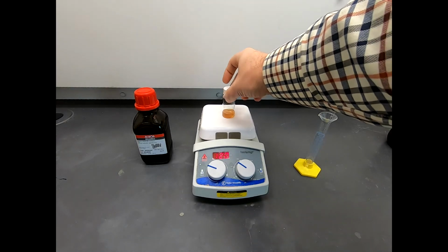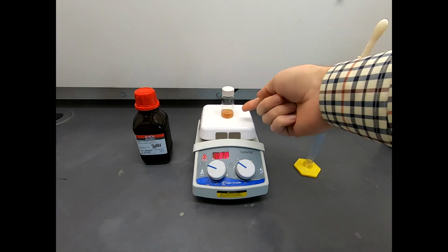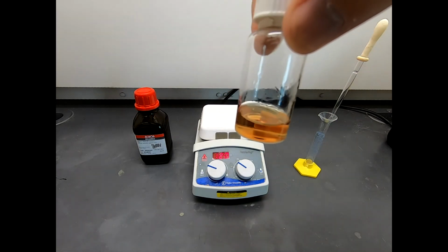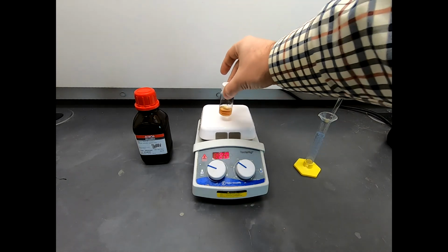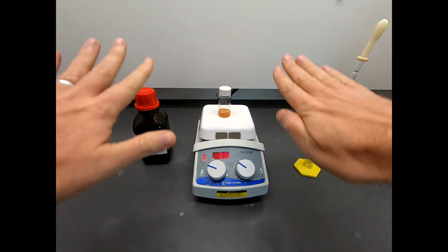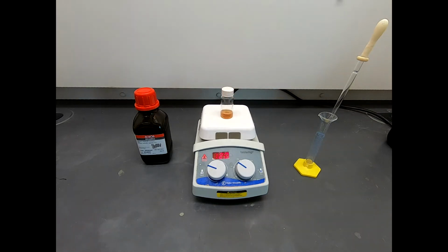Remember that we wanted it to heat but not vigorously boil. And this clearly hasn't boiled away to dryness at all. And there is, it's hard to see in the camera, a little bit of vapor condensation on the sides. I'm not sure that's coming through. That's a good sign we're getting some heating, but not overly vigorous heating. Again, the hot plate says 120, but that doesn't mean the reaction actually reaches that temperature. And as we have airflow in the hood, it cools the sides of the vial, and that helps us condense and recollect those vapors and return those to the reaction mixture.